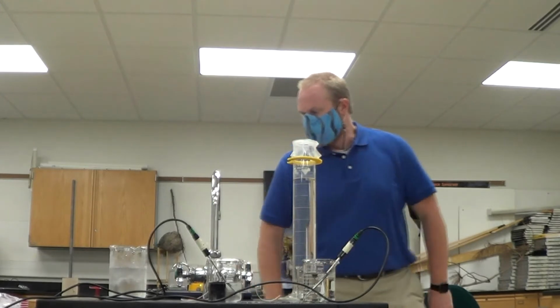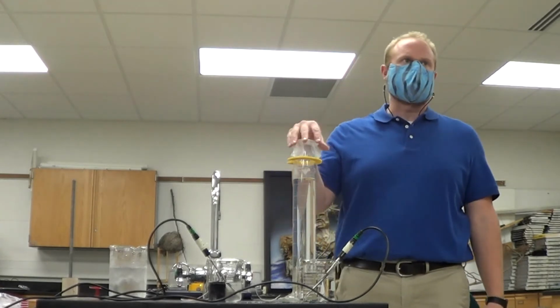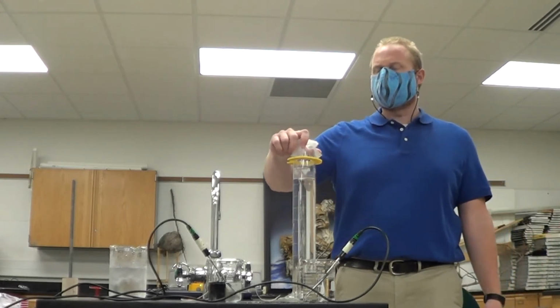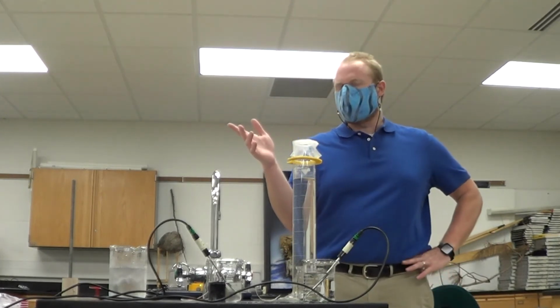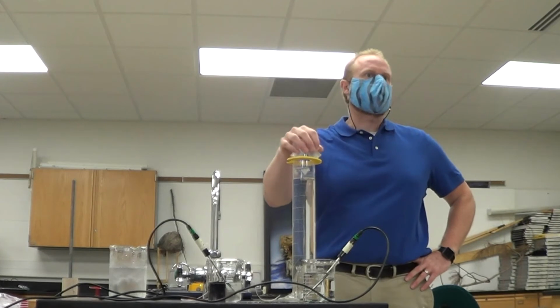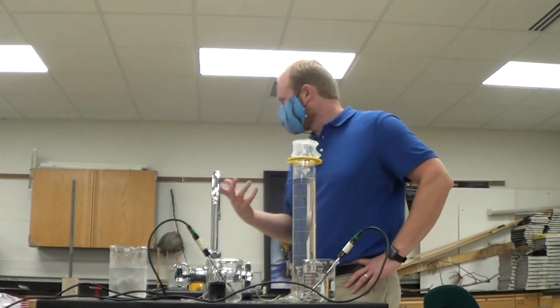So 8D, the actual volume today is 950 milliliters of water. So we started at 960, it's now at 950. So the volume of water went down a little bit, 10 mils, right? Do you think water evaporated from this? No, because you have the cover on. Right, we covered it. That was the intent of our cover, to try to eliminate as much evaporation as possible. For the record, 10 milliliters of water.